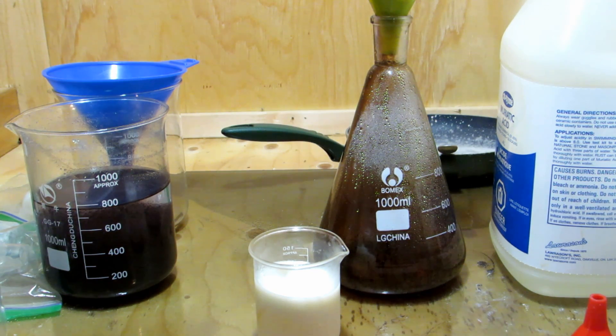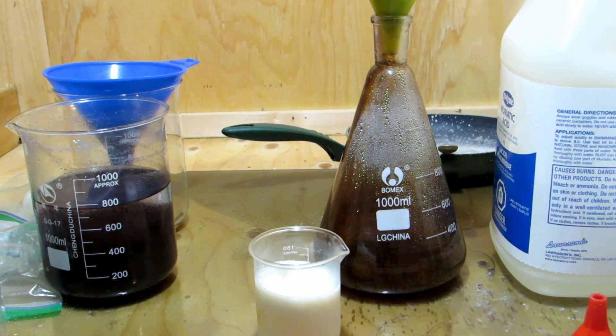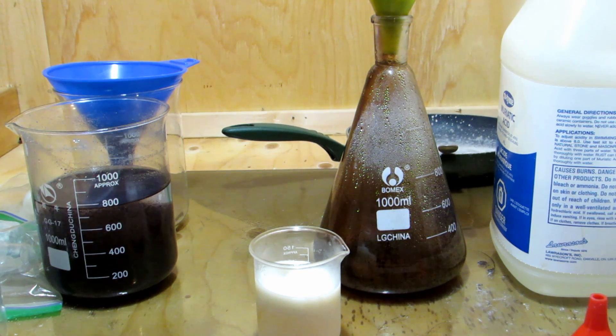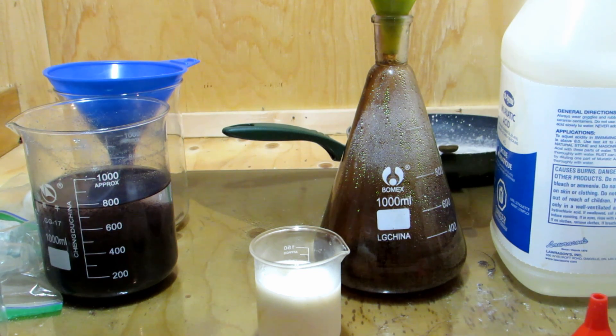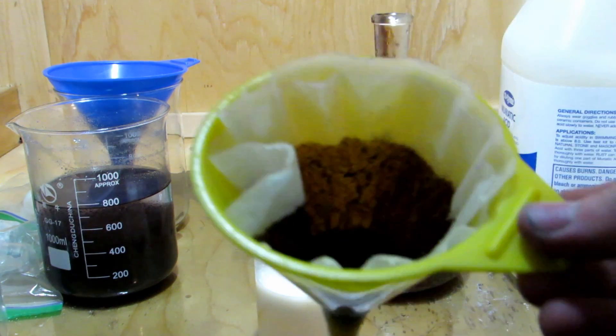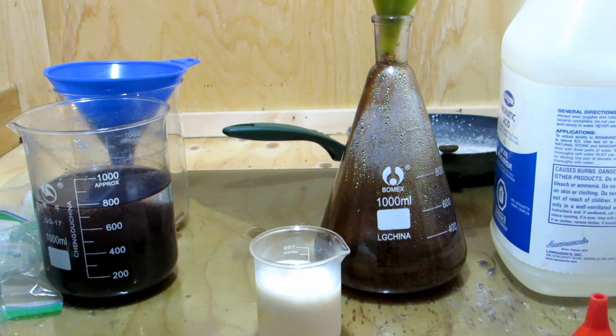I'm going to break this up with a glass stir rod, and we'll filter it off. Everything's crystallized out, so that's excellent. I'm very happy with that. The caffeine looks quite white and pure. We might do another recrystallization, but I'm very, very happy with what we have so far. It looks like water works just as well. You don't actually need ethanol to recrystallize this from. After whatever organic impurities we had in there, they were not soluble in the water. They're oily.